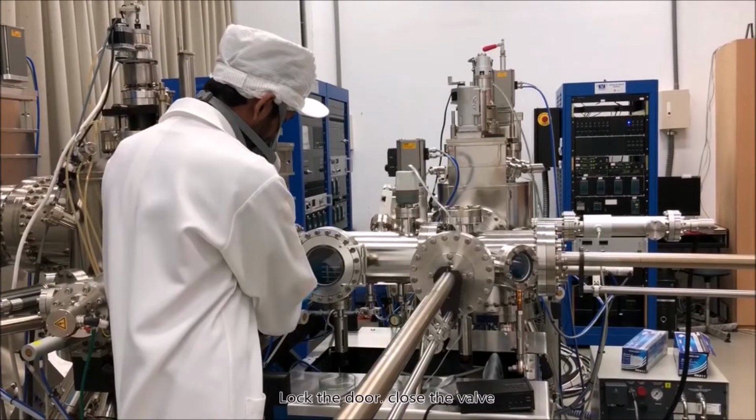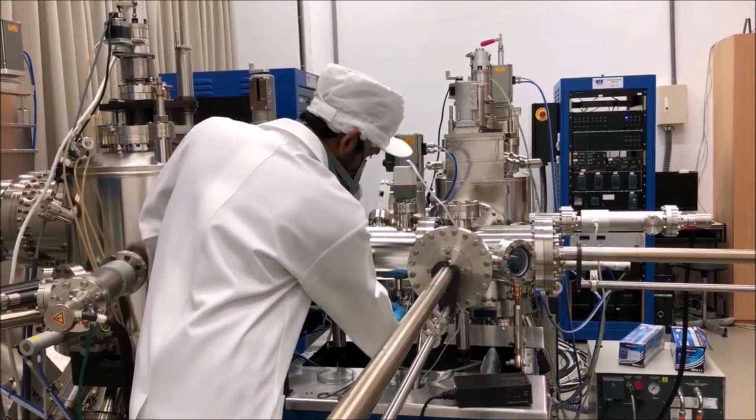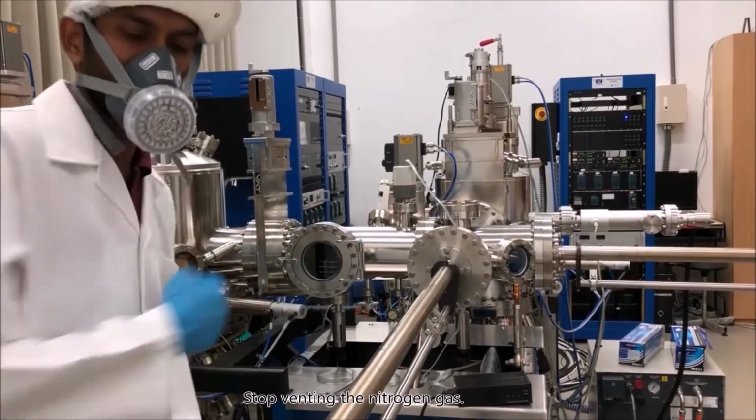Lock the door, close the valve, stop venting the nitrogen gas.